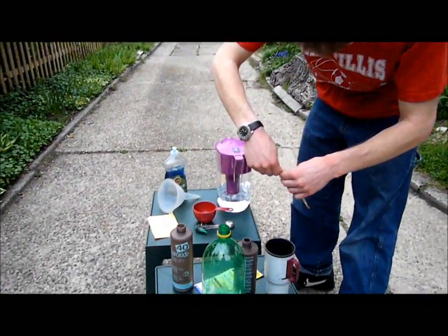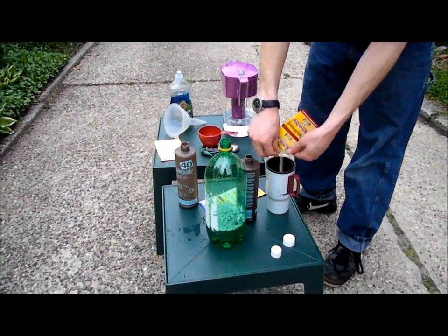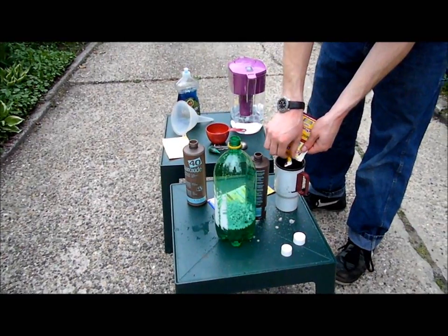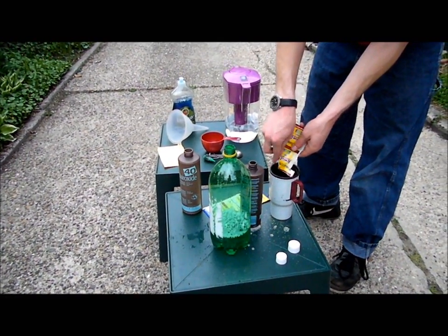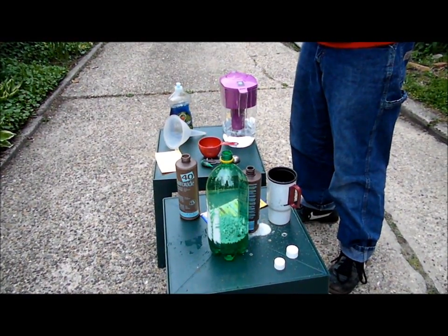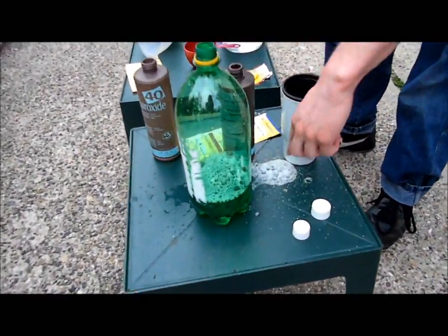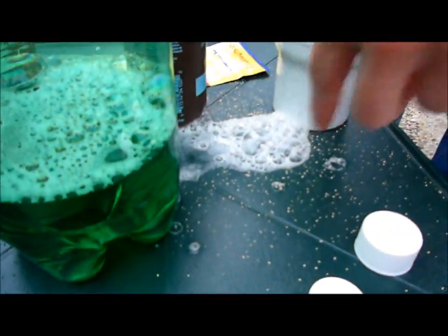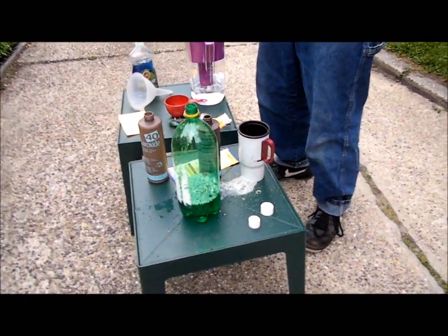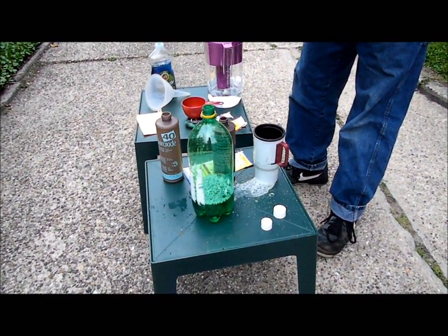So let me open this up. Put the yeast in. You actually hear the reaction taking place a little bit. This is what's actually happening. The yeast is catalyzing the hydrogen peroxide that leaked out of the bottle. So that's what it normally would look like, with gas evolving and a little bit of heat evolving too. But our experiment's going to be a little bit more exciting than just some bubbles.